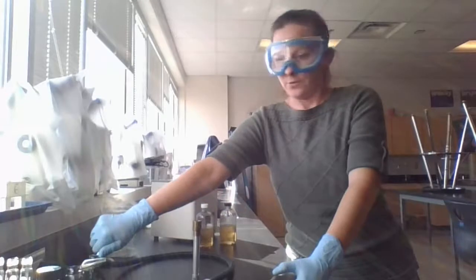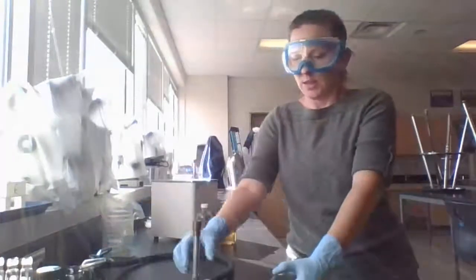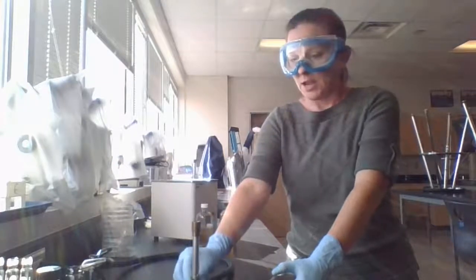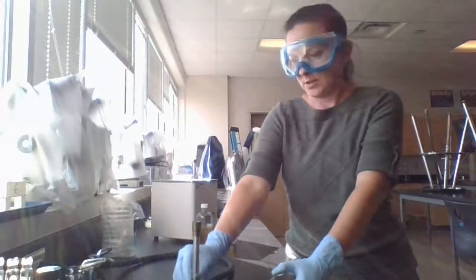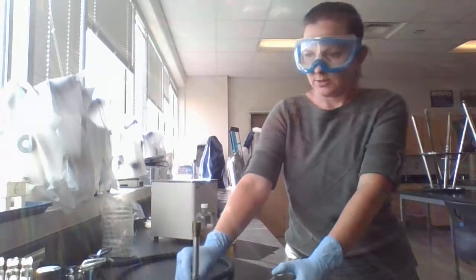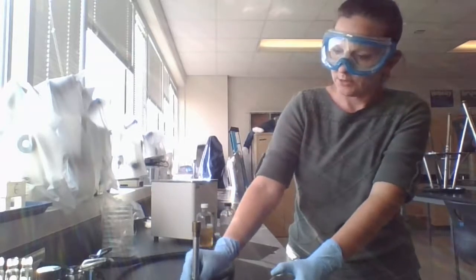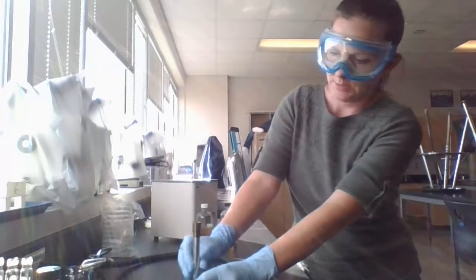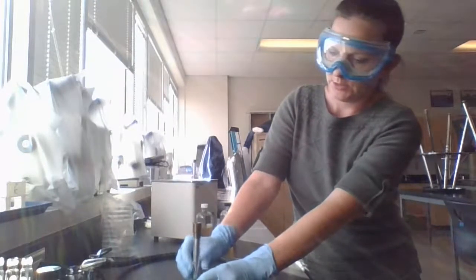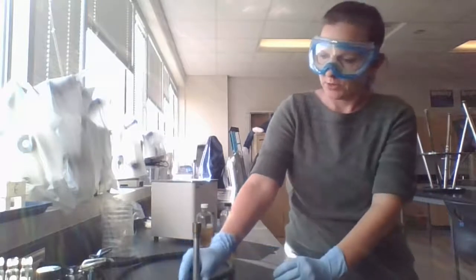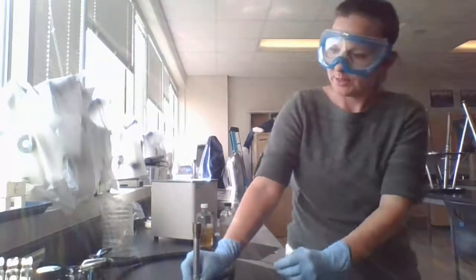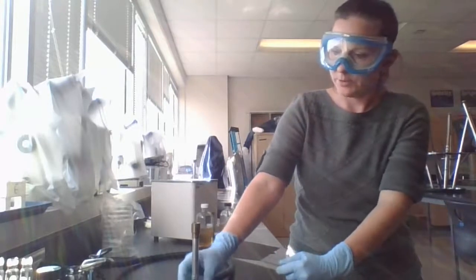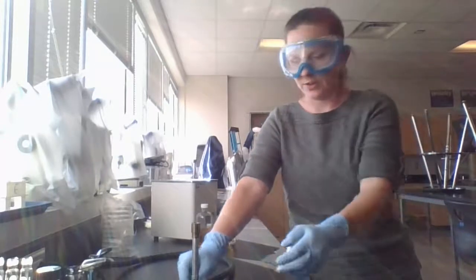I'm going to turn down the gas flow just a little bit. And notice my hair is pulled back. I don't have any loose clothing on. And then you're going to close this so that you have a nice blue flame. You don't want a red flame. I'm going to make sure that this is on here tight. So where you can kind of see like little bits of red every once in a while, that's not the kind of flame you want. You want a nice solid blue flame.